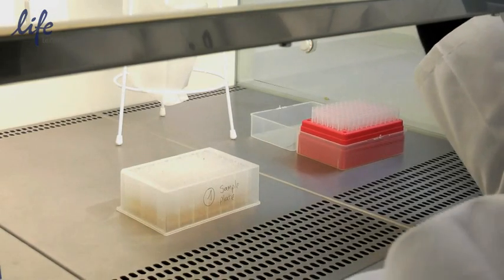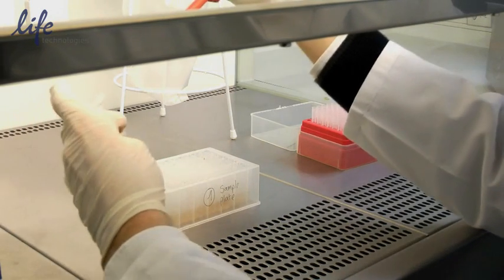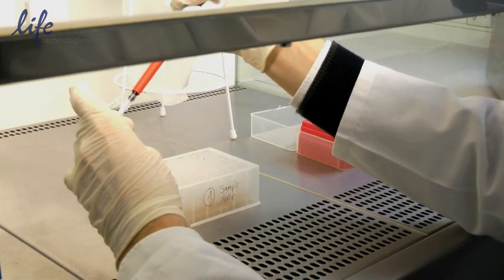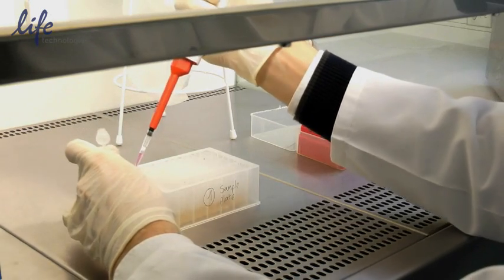Now we're adding our samples into the solution using a single pipette of course. We'll be doing as many samples as required up to a maximum of 96.